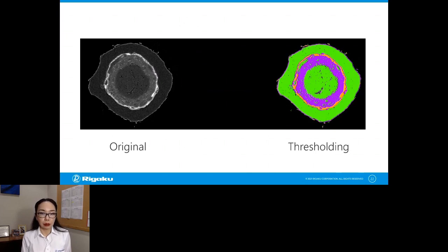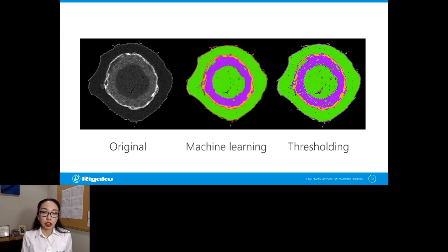And this is not a great segmentation analysis, because you see those purple bits in the green phase, and those are coming from the noise. And also this core phase and this outer phase, those are two different things, but you can't tell the difference because their gray levels are almost the same. You could use machine learning. I'm talking about something simple like a random forest. Then you can clean up the noise, but still this core phase and outer phase look the same because even machine learning is based on local average gray level.